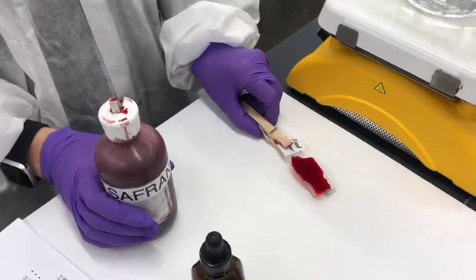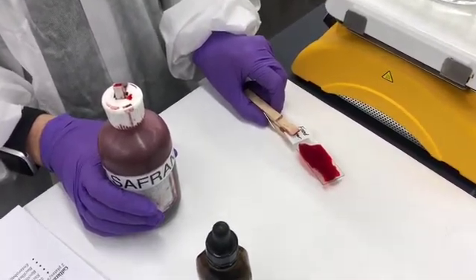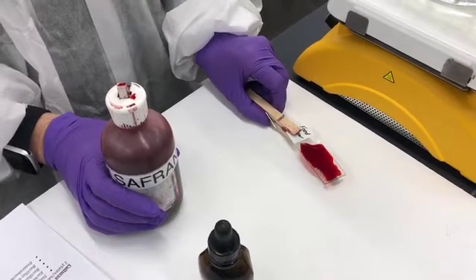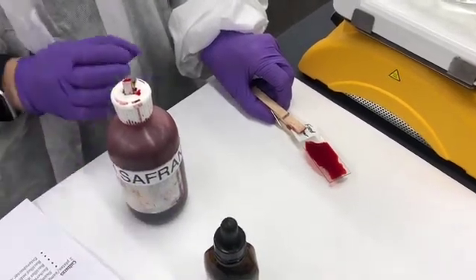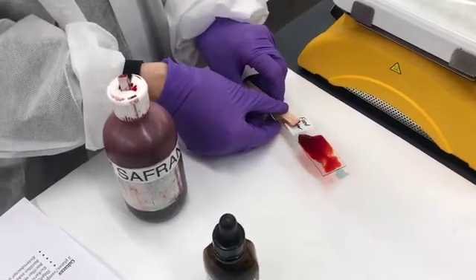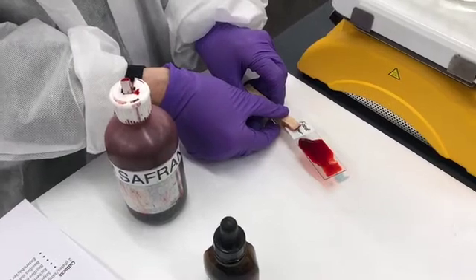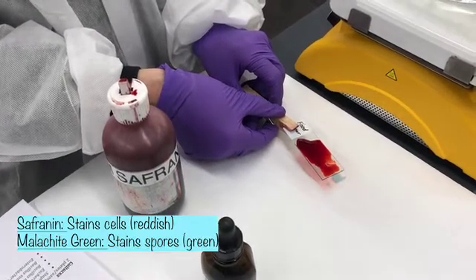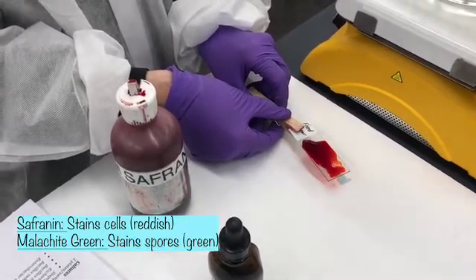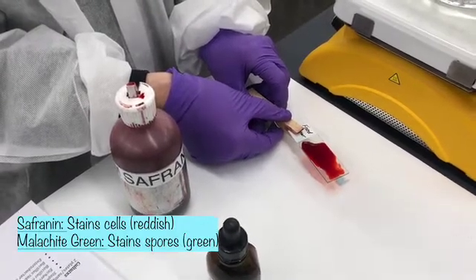Now, the steam heat allowed the endospores that may or may not be present in your sample to essentially open up and accept the dye. And this counter stain is going to stain everything. Actually, the endospores will resist the stain, but whether you're a vegetative cell, any other cell will pick up this red dye.